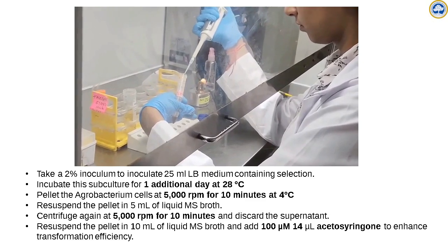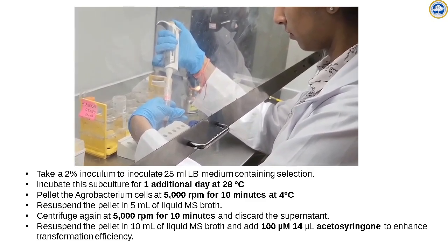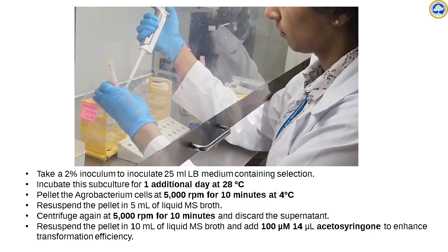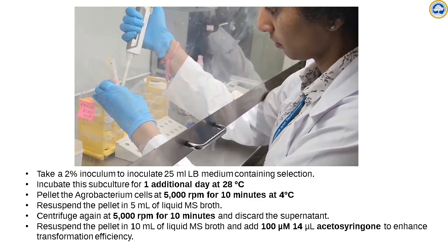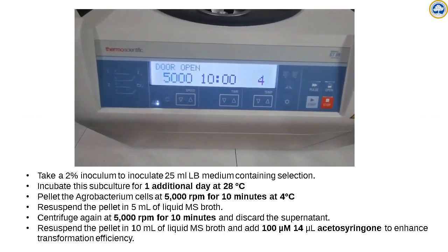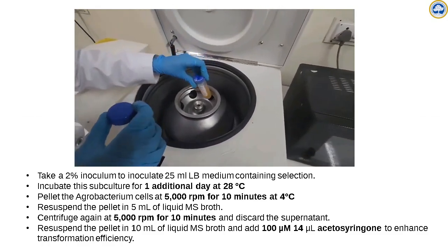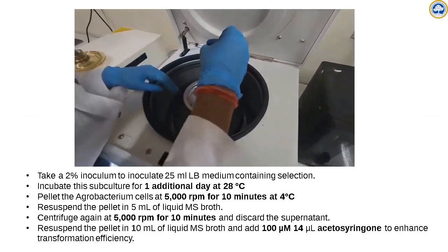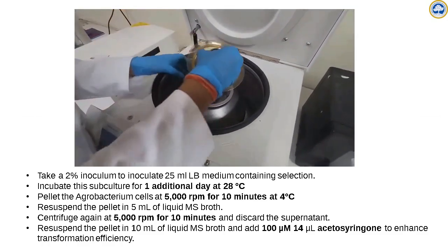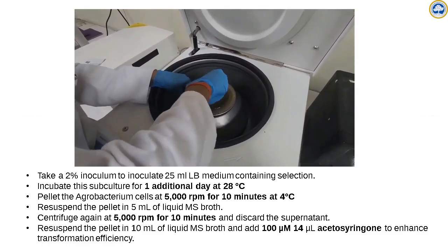We make 25 ml LB broth and add the selection, 50 microgram of kanamycin per ml and 10 microgram of rifampicin per ml, and then we add 2% or 1% inoculum from the mother culture. We culture this for another day so that the OD reaches 1 to 1.2, and then we pellet down the cells. Pelleting can be done at 5000 rpm for 10 minutes or 5 minutes, or 10,000 rpm for 1 minute, preferably at 4 degrees Celsius.